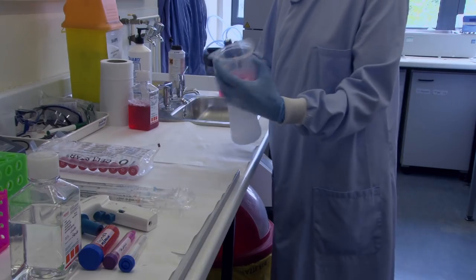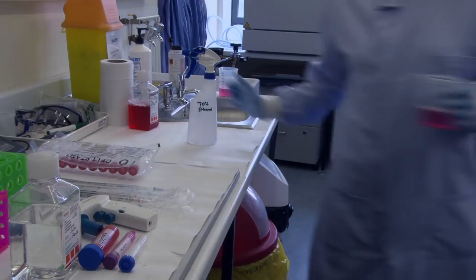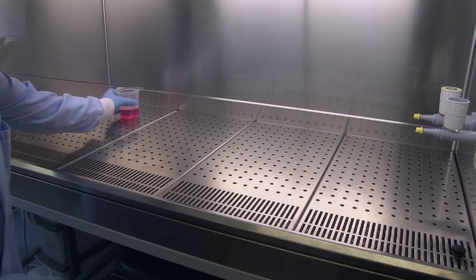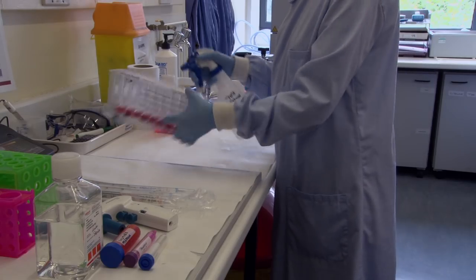The gloves protect your sample from the microorganisms on your skin. Once your gloves are sterile don't touch your hair or skin or you'll get contamination.